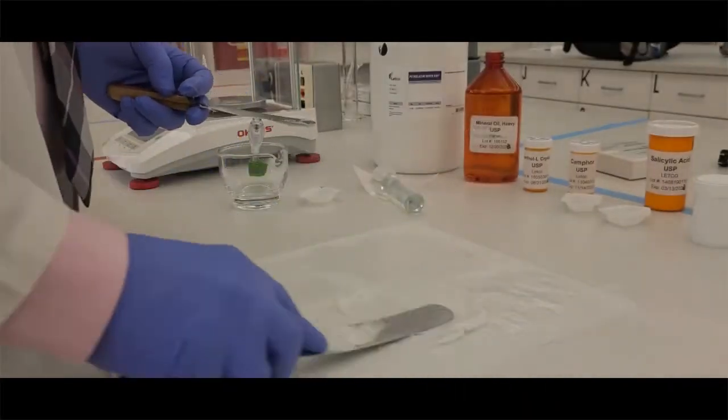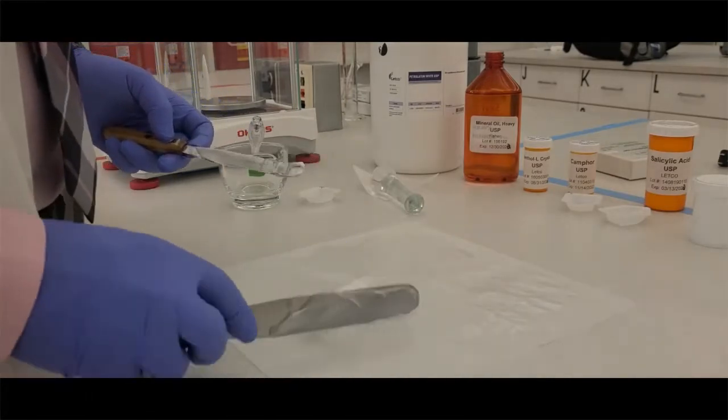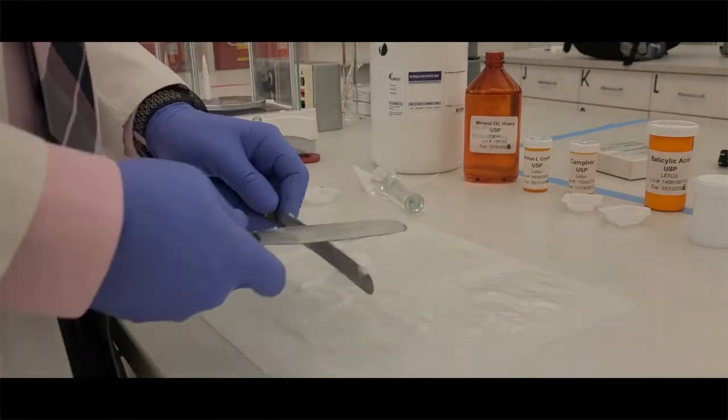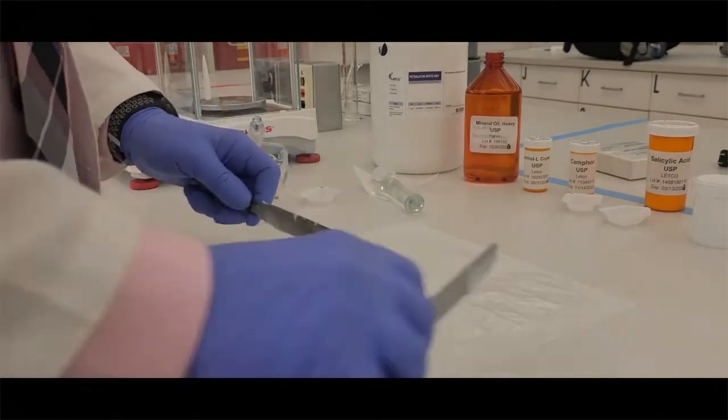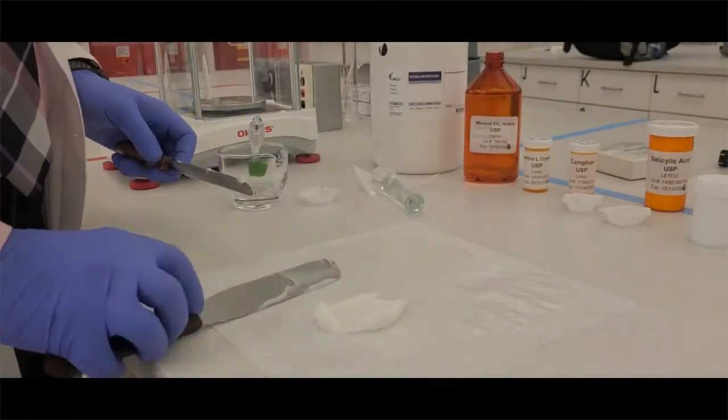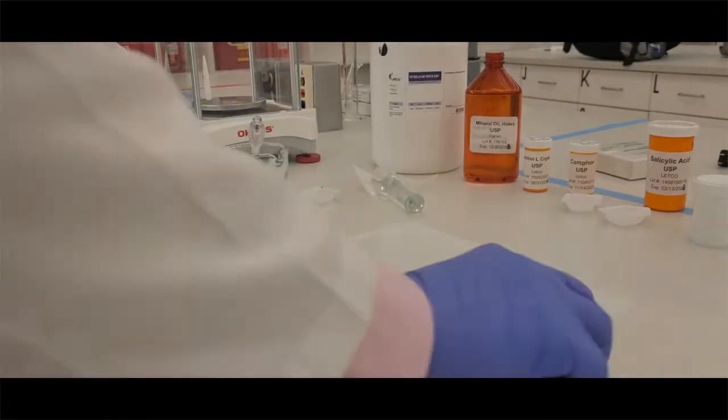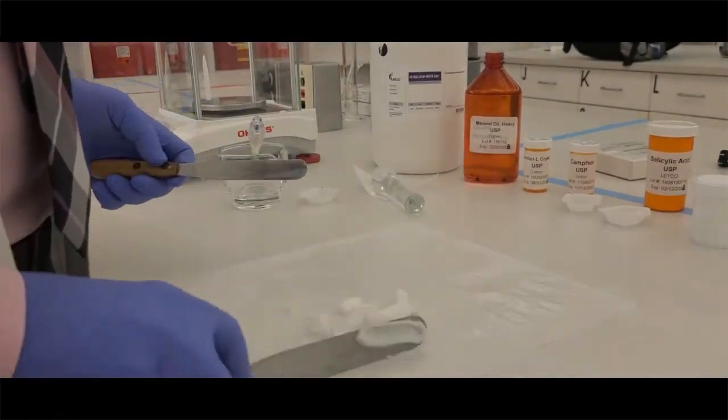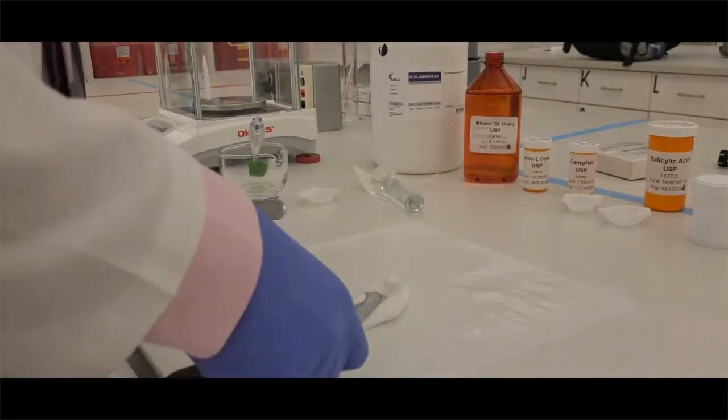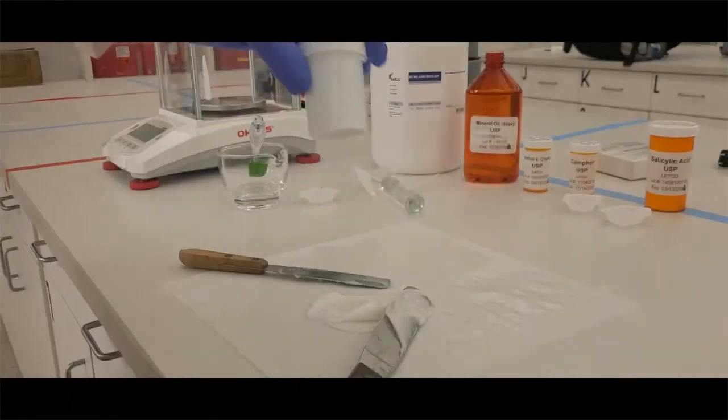As I go back and forth, notice I'm using the spatula that's smaller to scrape off some of the excess ointment that starts to creep up or around. I'm also trying to keep the area clean. Watch out very carefully with using that paper. If you do scrape the paper too hard, you will rip it. So do carefully when you're scraping the paper to accumulate all the ointment to the center there.